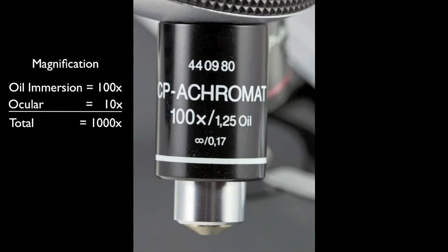After focusing and centering the bacteria using the high power objective, you should rotate it out of the way and place a drop of immersion oil onto the slide. Then, complete the rotation until the oil immersion lens is in place. You will probably have to open up the aperture using the diaphragm lever in order to have enough light to see the bacteria clearly.